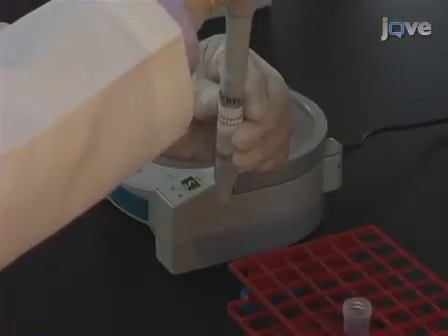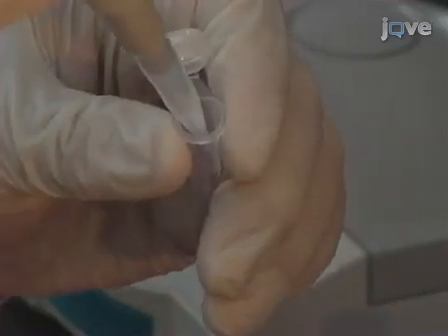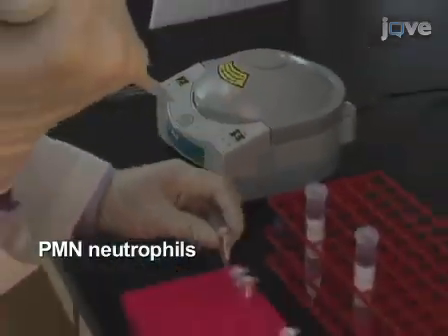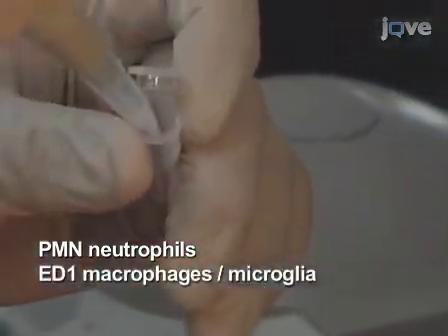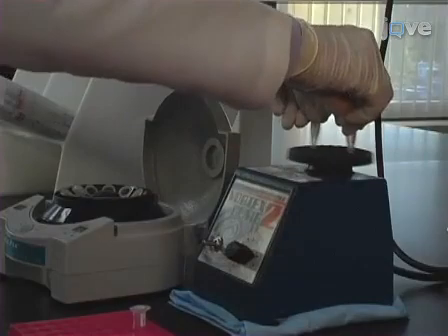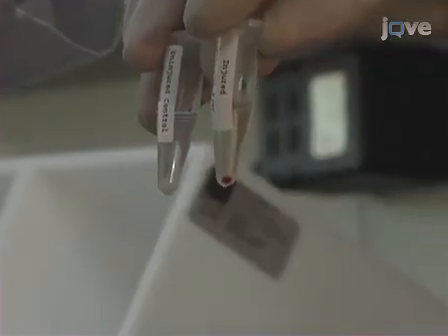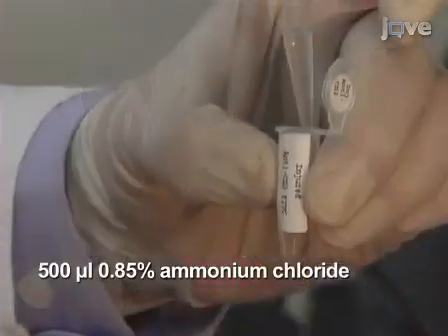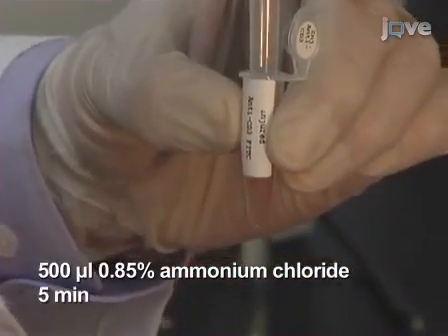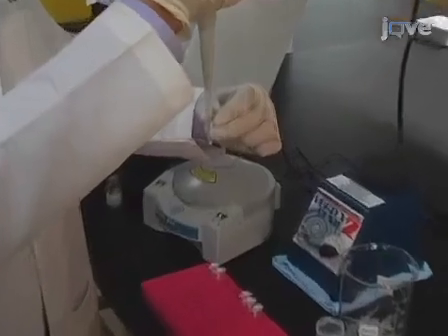For both uninjured control and 1-day post-injured sample, 500 microliters of cells are transferred into 1.5 milliliter tubes labeled separately for PMN neutrophils, ED1 macrophages microglia, and CD3 T cells. Cells are pelleted by centrifugation for 2 minutes at 5000 rpm at room temperature. Resuspend the cell pellet in 500 microliters of 0.85% ammonium chloride to lyse the red blood cells. Incubate for 5 minutes at room temperature, then centrifuge again for 2 minutes at 5000 rpm. Then wash the cells with 500 microliters of HBSS and centrifuge again.